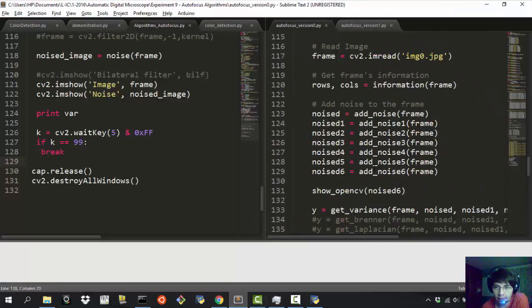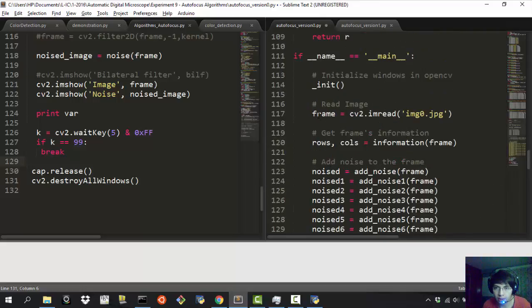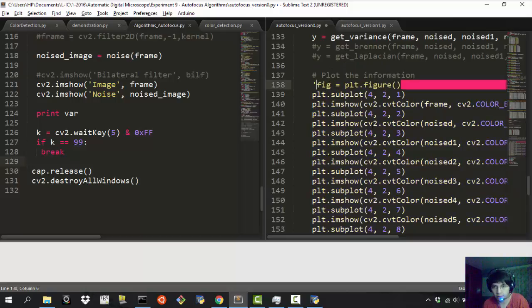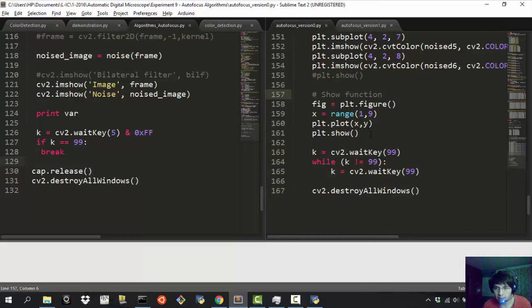And as I'm making the right modifications here, I just want to tell you that the energy of the Laplace is the one that has the best results, I think, for me. Some papers say that you need to find the algorithm that suits better for your image, because you're going to have images that have high density background, low density background, and that's going to be another feature that you have to check whenever you're making an autofocus algorithm. But I have seen so far that the energy of the Laplace seems to be a very good approach to finding what I want.